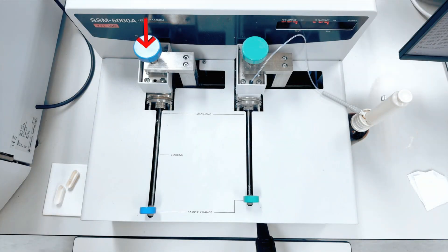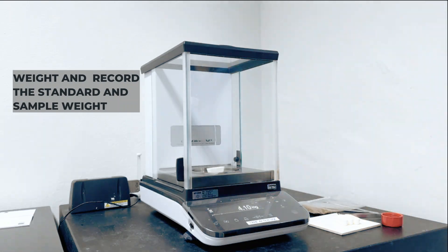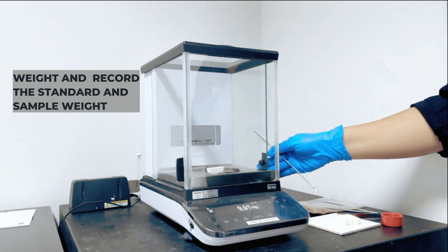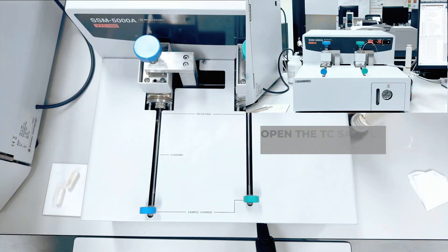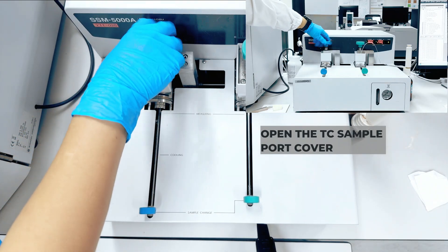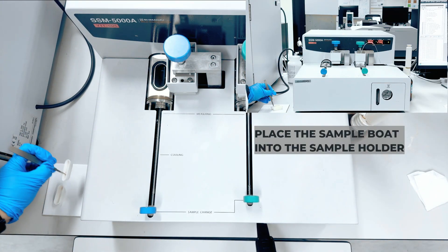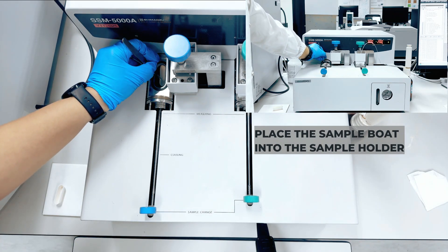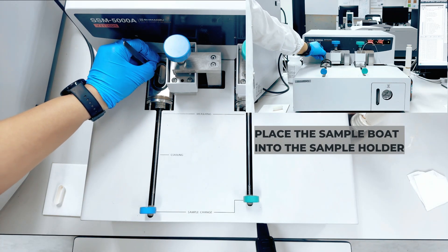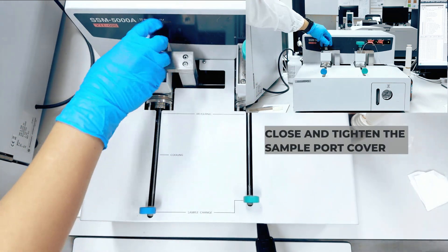We will start with the TC analysis. First, weigh the standards and the sample, and record their weights. Then open the TC sample port cover and place the sample boat containing the sample into the sample holder. Close and tighten the cover.